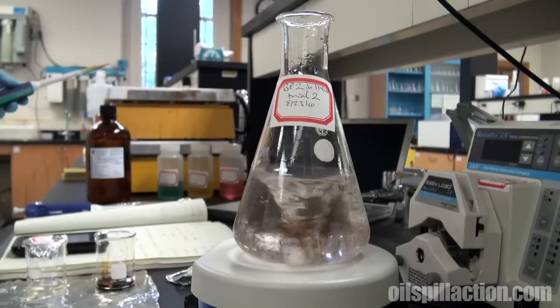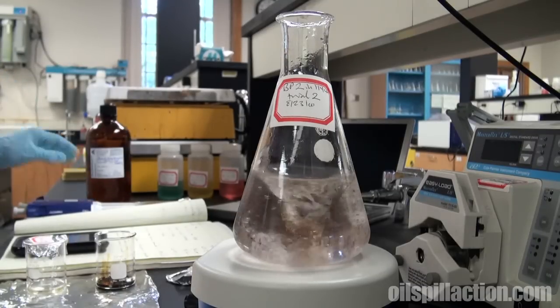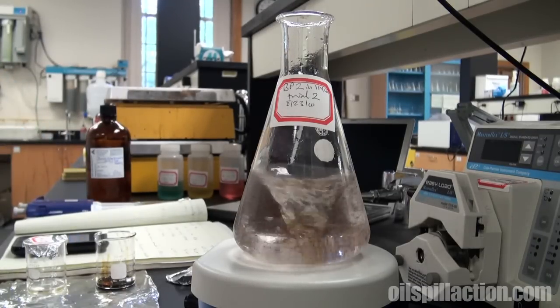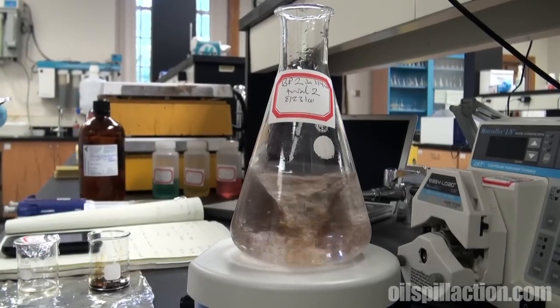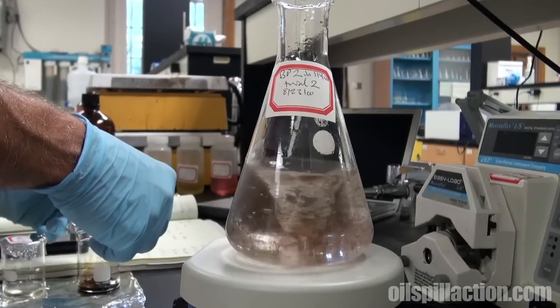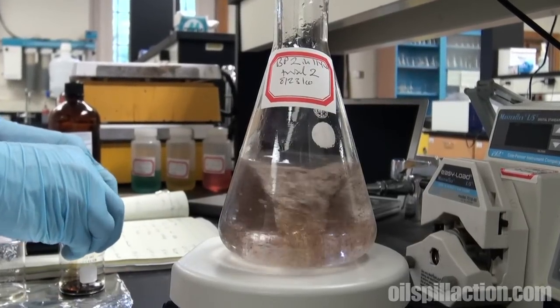If you look carefully, you can see that the oil is forming a large number of small droplets being spun by the magnetic stirrer. So we'll let that go for about a minute and stir up.